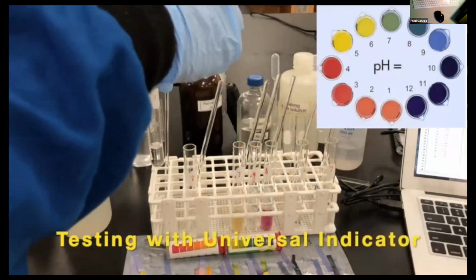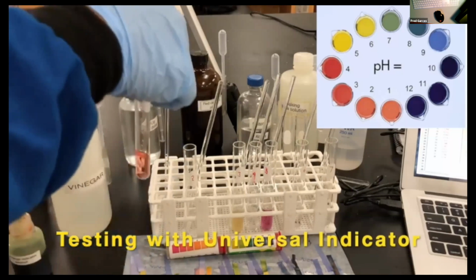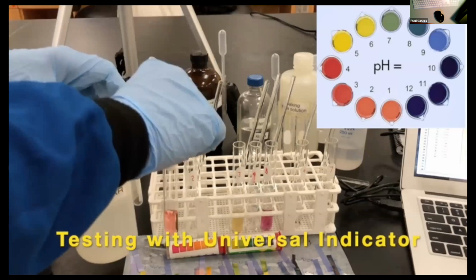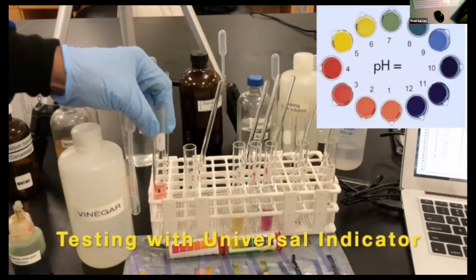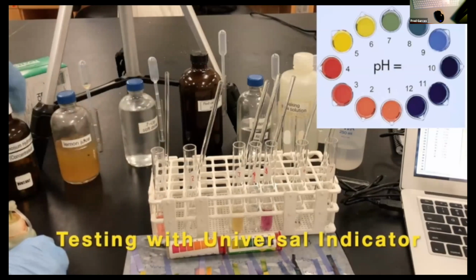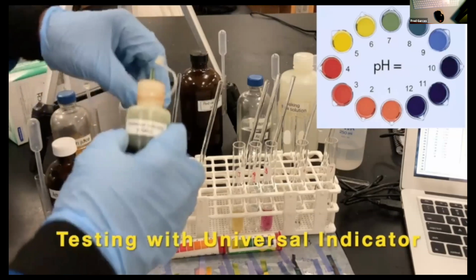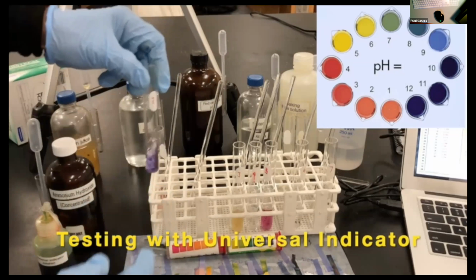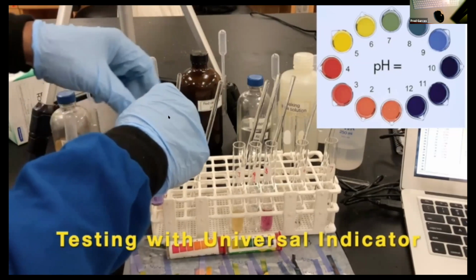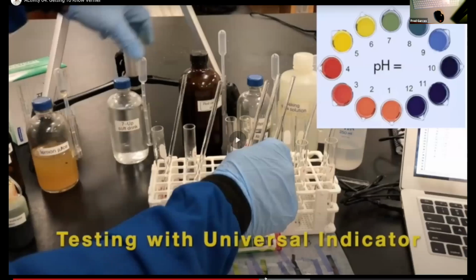Now I'm putting in here some universal indicator, and the universal indicator legend is to the right. So I'm taking the whole solution now, I'm putting in universal indicator. And again, it'll give you some sort of pH range. And I'm putting another drop or 2 into the ammonia. You guys will use the legend right here to the right to give an approximate pH of what that is. I'm going to fast forward.